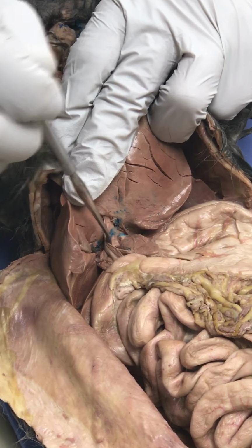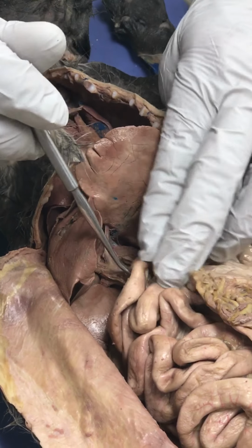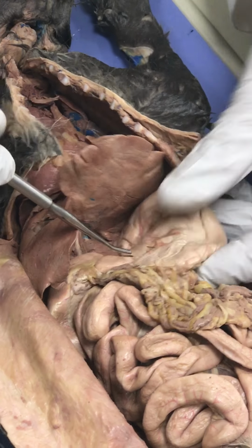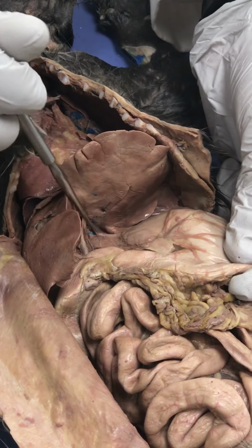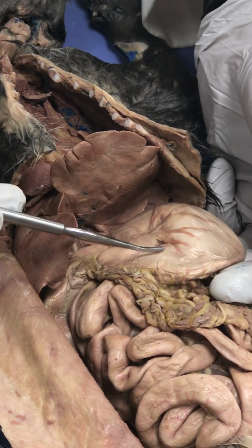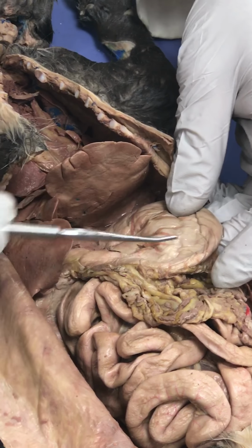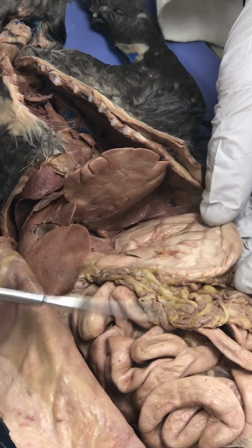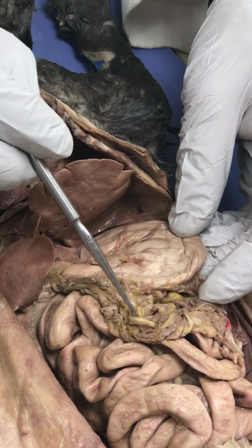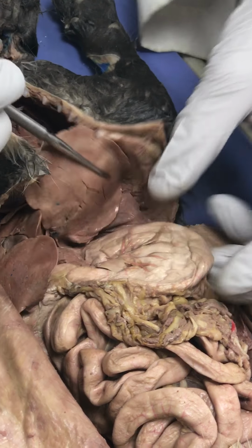And then there's another ligament there that attaches to the small intestine, and another one that comes over here and attaches to the stomach. The ligament attaches to the base of the liver here, and this is the lesser omentum. This cat is young, and so it doesn't have a lot of fat, but very often when you see a cat, the lesser omentum will have a lot of fat strands like this all the way across it, all right?